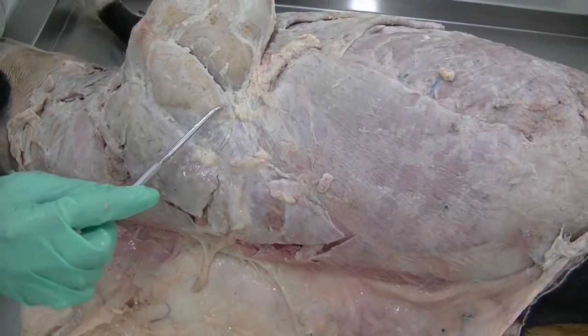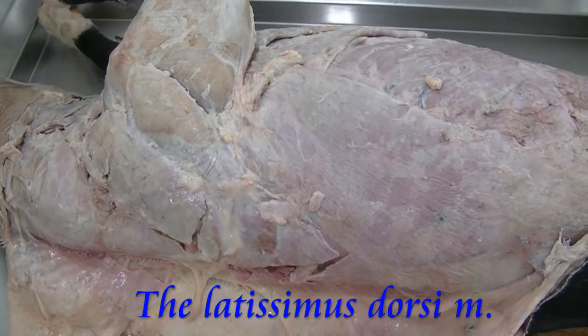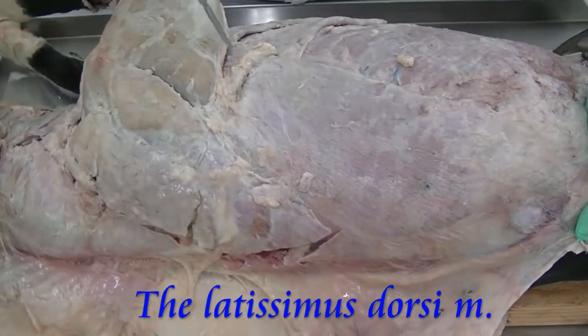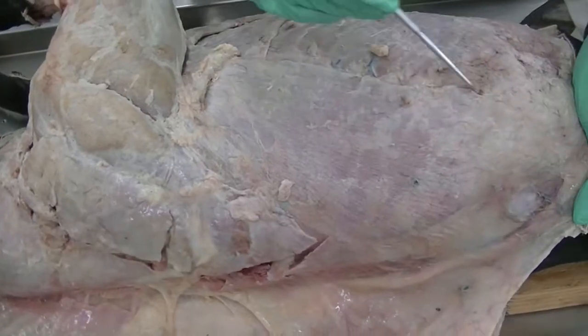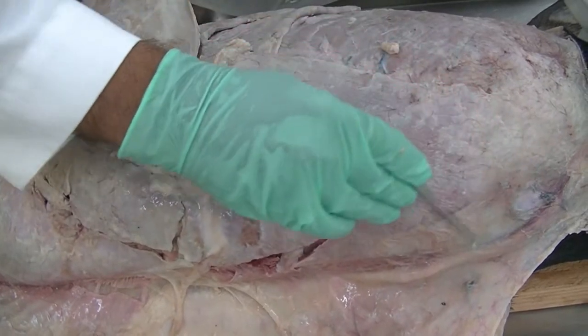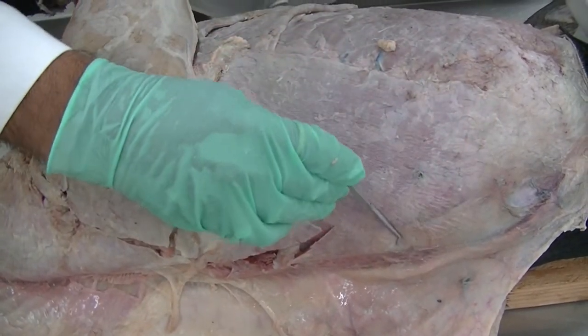So we see here that is the latissimus dorsi. The muscle extends from the thoracolumbar fascia and it further goes towards the humerus to get attached to the teres tuberosity of the humerus. That is the ventral border of the muscle, and we see the muscle fibers going towards the dorsal midline, where the aponeurosis seems to be merging with the thoracolumbar fascia.